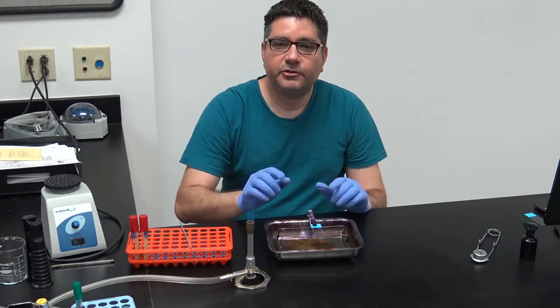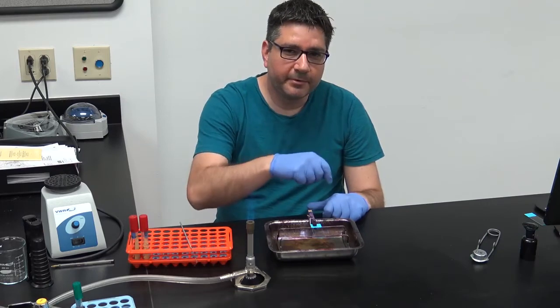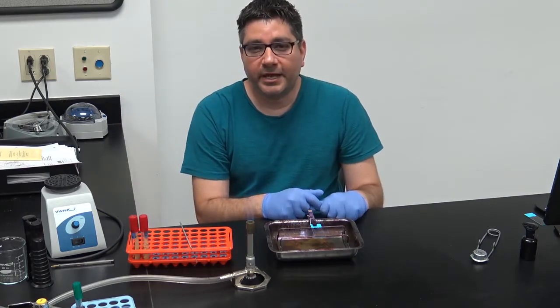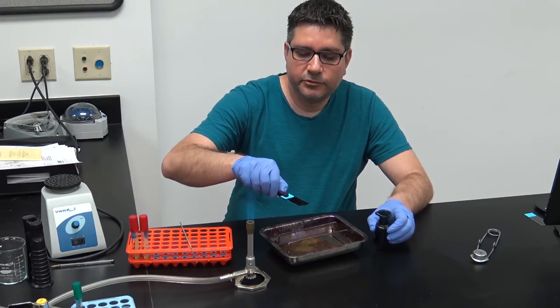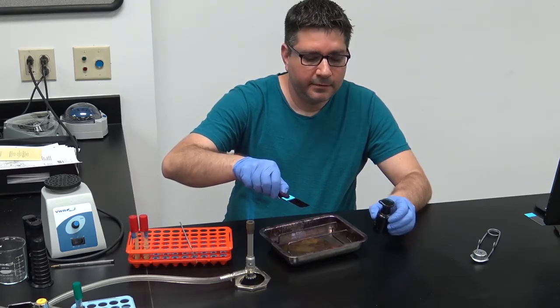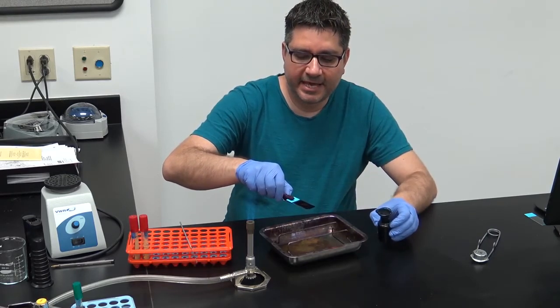This steaming procedure goes on for 5 minutes, upon which you will remove the tissue paper, if used, and drain and wash with DI water. Care should be taken to not allow for the stain to dry fully on the slide. Additional stain should be added when this is the case.